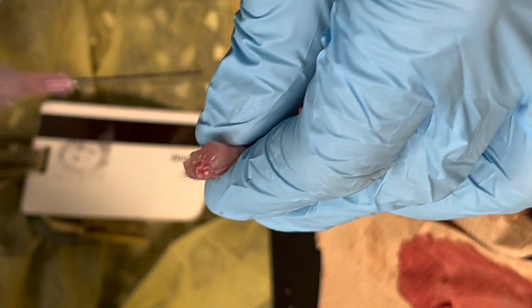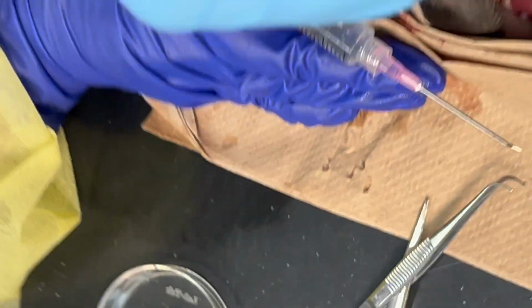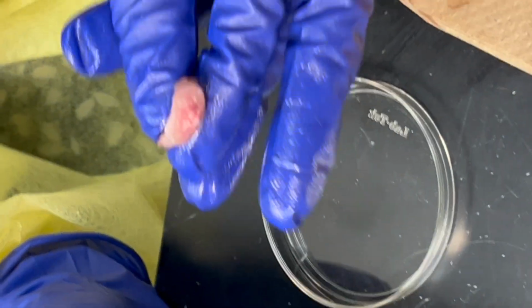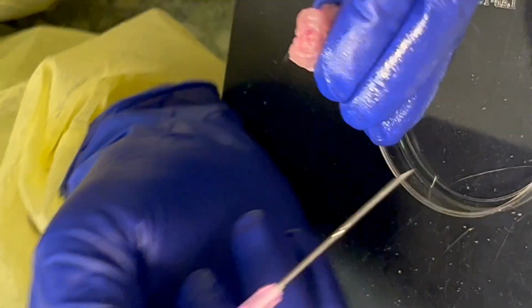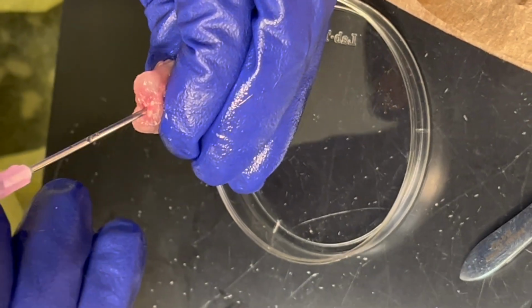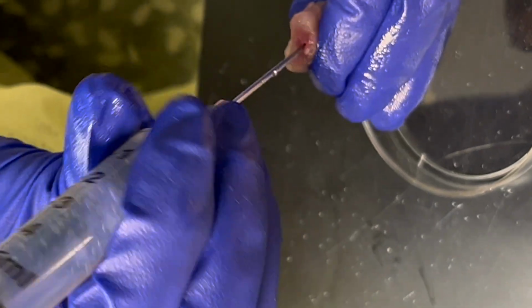So what I'm gonna do now is show you how much I'm gonna go with this needle bit. One thing I do is I try to keep this whole thing straight with the fingers. Then I will put it in here again, and slowly almost drill the part so that I can get in a little bit more.